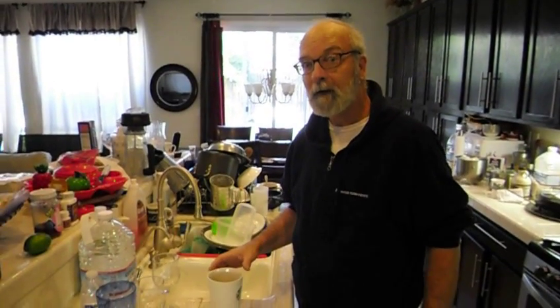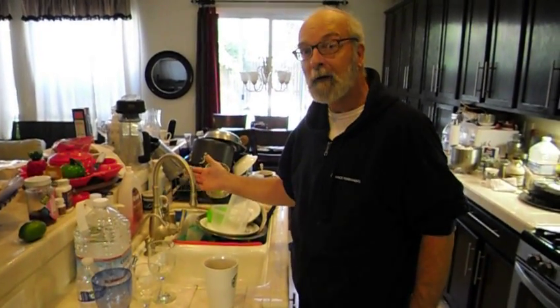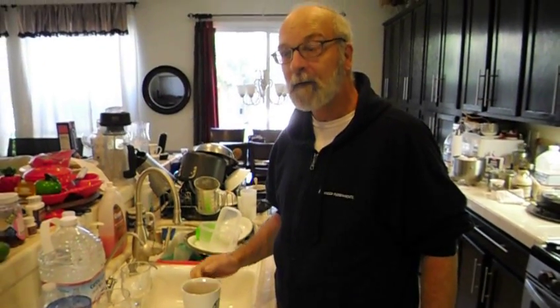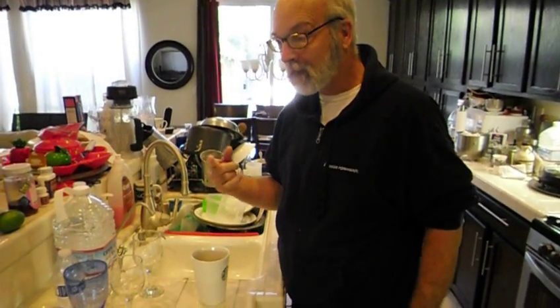For years I've been drinking coffee from this tap water. I live in Elk Grove, California and the coffee tastes really bad. I've tried all kinds of different flavors of coffee. So we're going to do a test today.